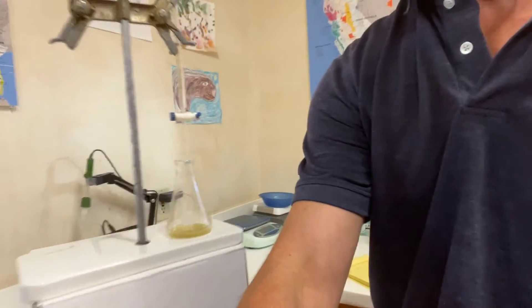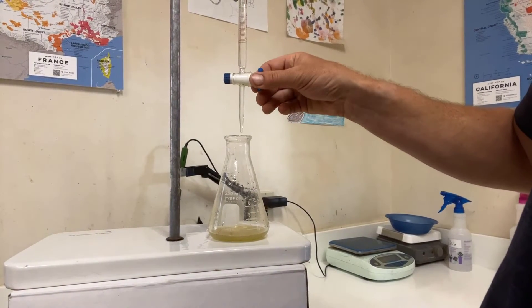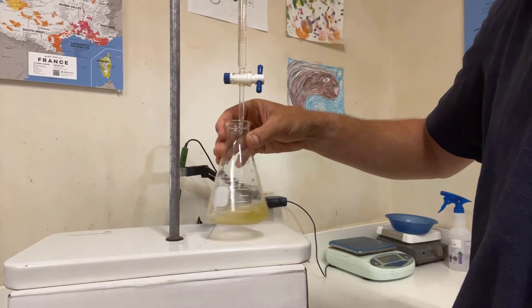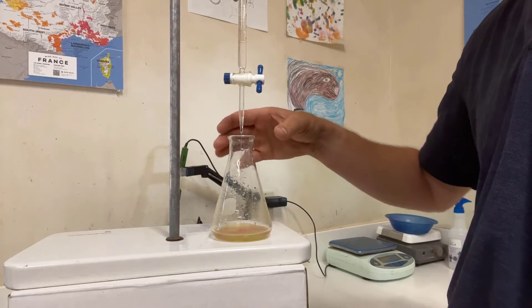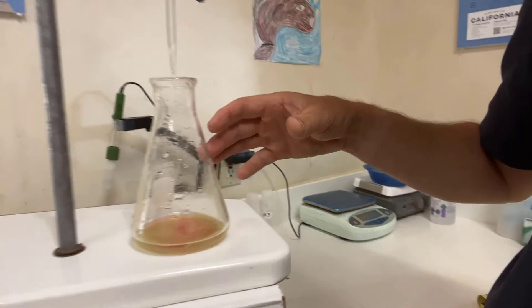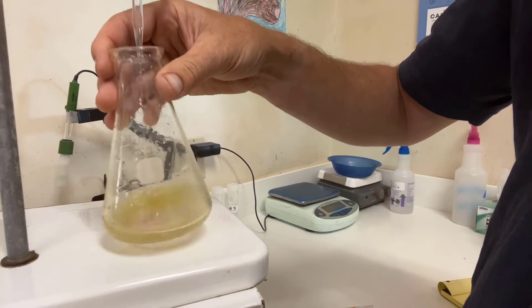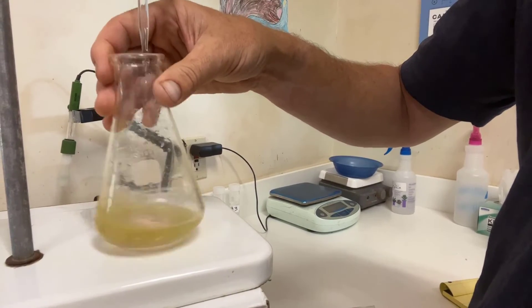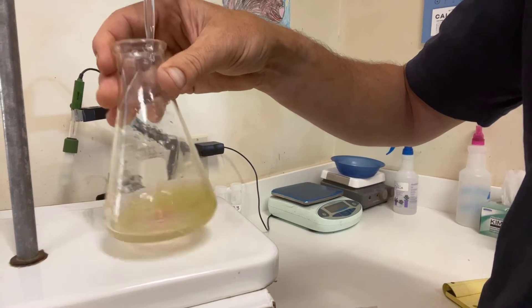Okay. Now I'm going to scoot this in so you can see this colorimetric reaction. So I'm going to open this valve and start delivering the sodium hydroxide down into the juice sample. And you can see there's a bit of a color change there. It's turning pink. I don't know how well it comes through in the video. But the pH of the juice is constantly increasing as we're adding the sodium hydroxide. We're shooting for pH 8.2. That's when everything is going to turn pink and remain pink.